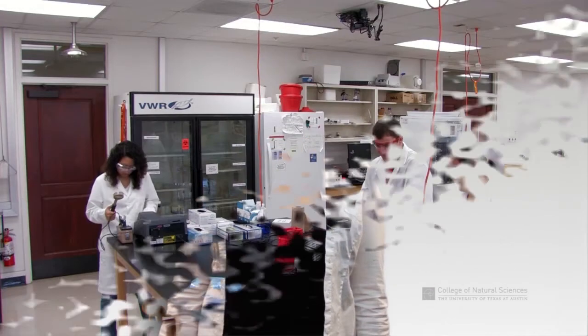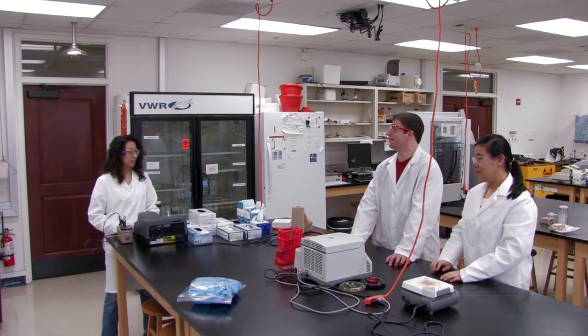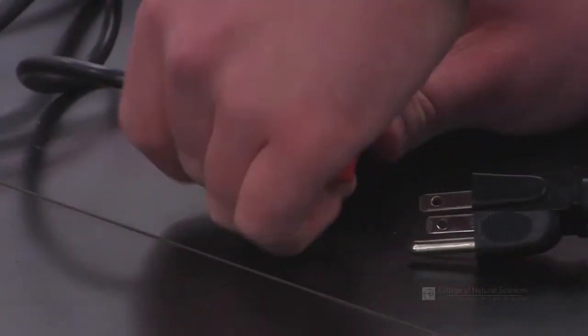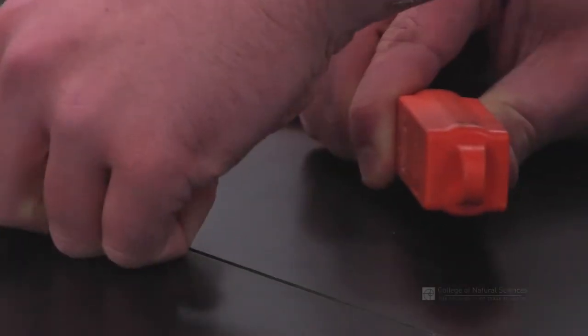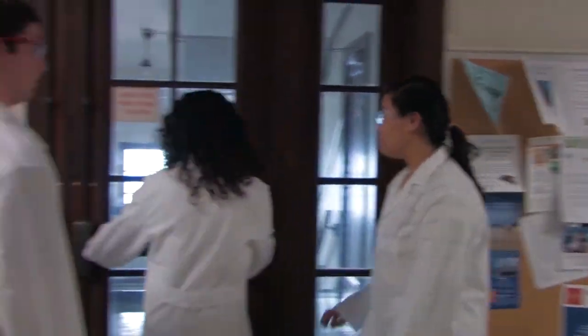A building evacuation may be necessary in the event of an incident in a different area of the building, a natural disaster, or other unforeseen incidents. Should a signal be given to evacuate a building, you should remain calm. Turn off any lab equipment that may be a fire hazard if possible. Quickly exit the building. Do not take elevators.